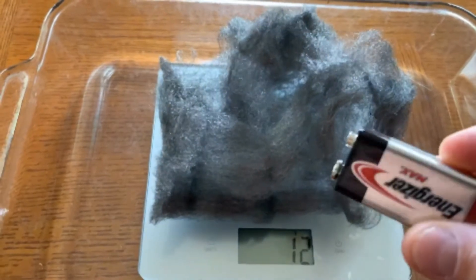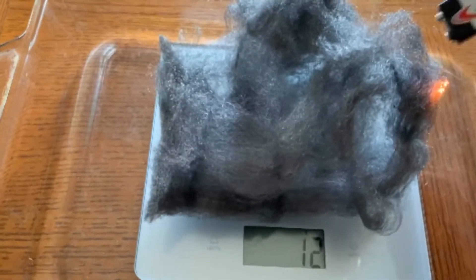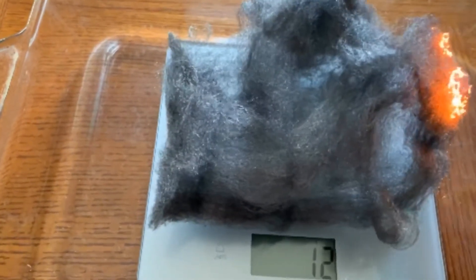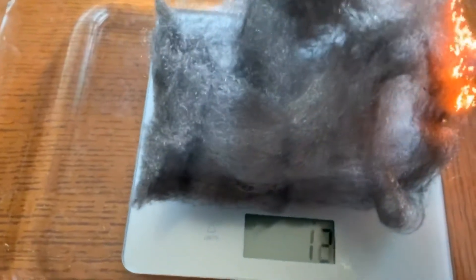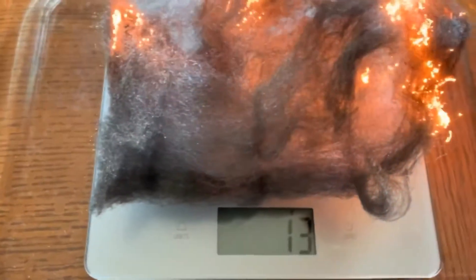All I'm going to do is touch it with this 9-volt battery and allow it to begin combustion. Keep your eye on the scale.